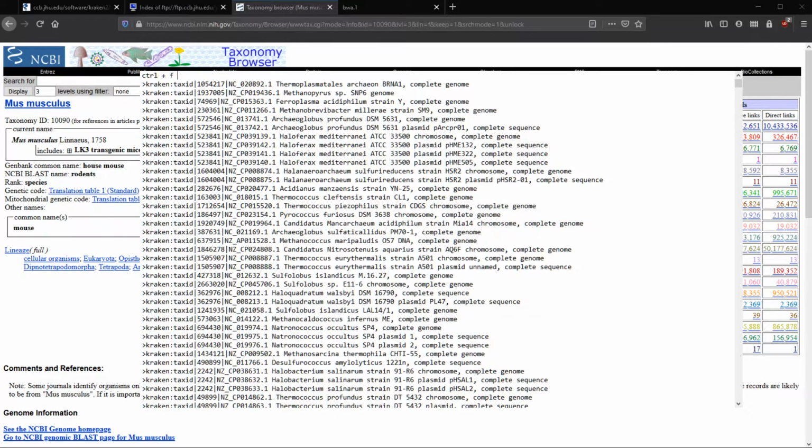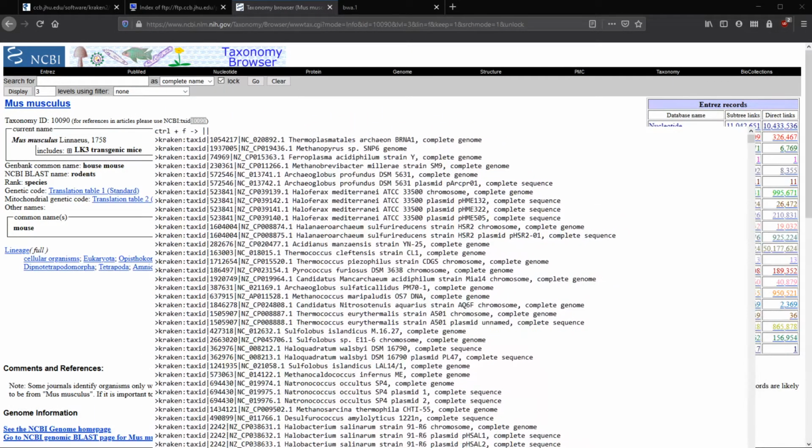And then once we have that, inside of our find window, we can paste something that is our tax ID. So if we move this a little bit, you can see that our tax ID on the NCBI page is 10090. So in Notepad, you can do the Control F to find and then type in 10090.